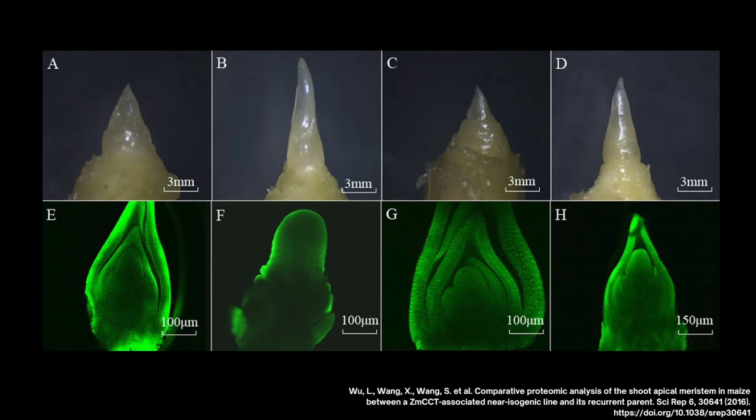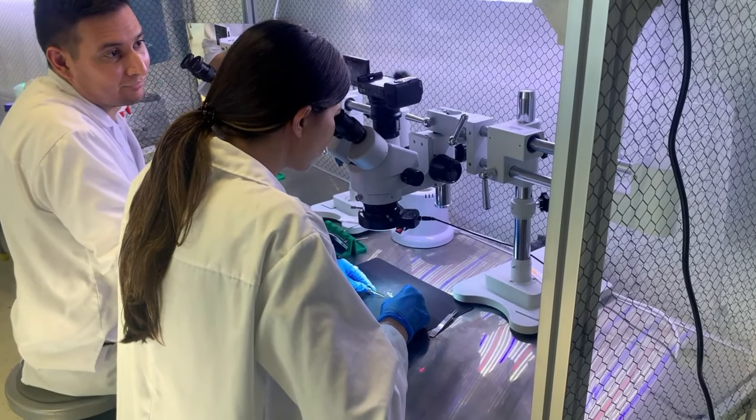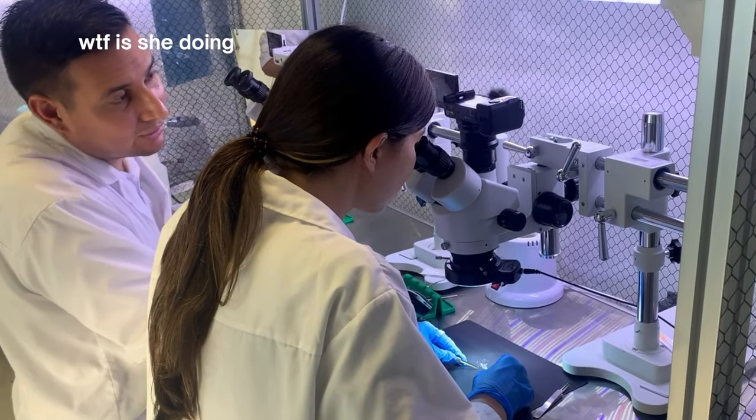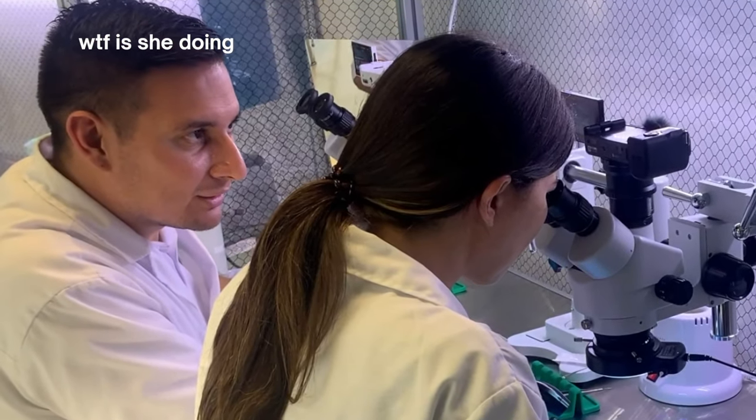But what is a plant meristem, and where do I find it? Meristems are the part of a plant responsible for growth and development. Apical meristems are located at the shoot tips and root tips of a plant, and they are responsible for primary growth and elongation. The challenging part about doing this type of tissue culture is that the meristem is very small — like stupidly small. Whatever you are thinking, it is smaller than that. Because of this, you usually use a microscope to do this procedure, and even with a microscope, it's really challenging. Francisco from Plant Cell Technology is going to be doing the demonstrations today because I am so bad at this.